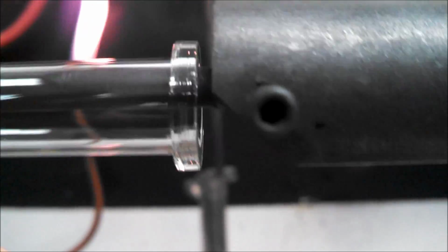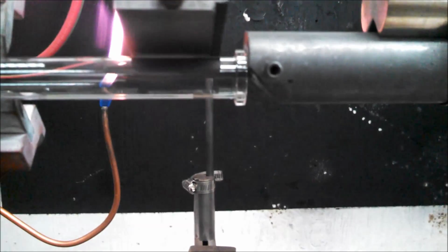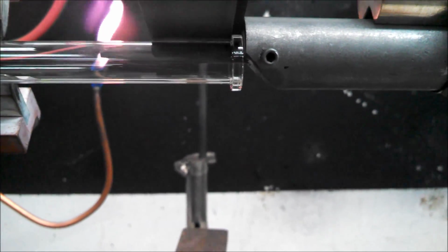achieve this. So when you're working the piece, this is run up against you like so. You gather the glass up and then you bring this paddle. Let's see if I can get this on here so you can see it. So it rests up against the graphite and it fills the glass, and you bring a tailstock in as you're filling the gap in.